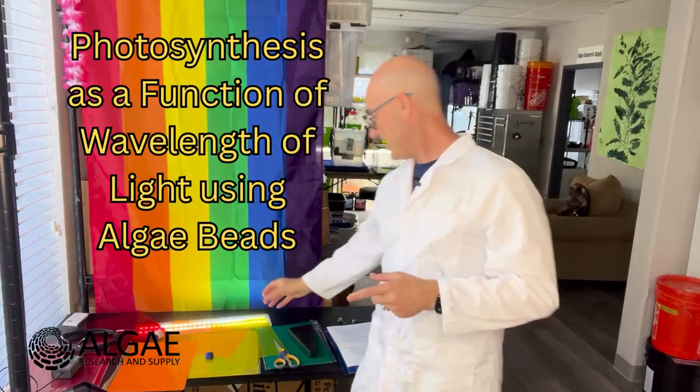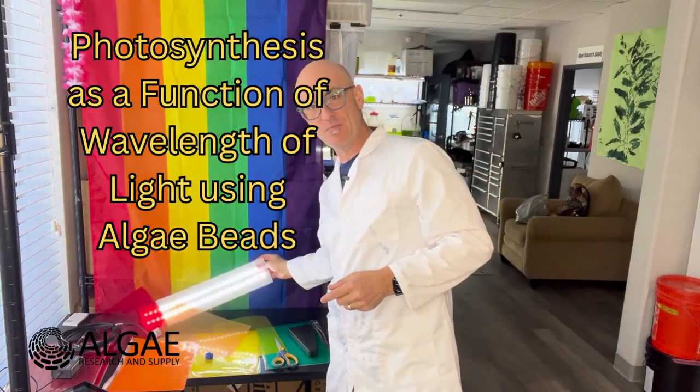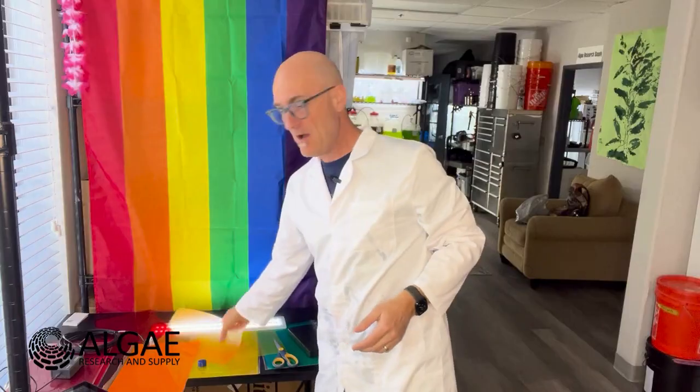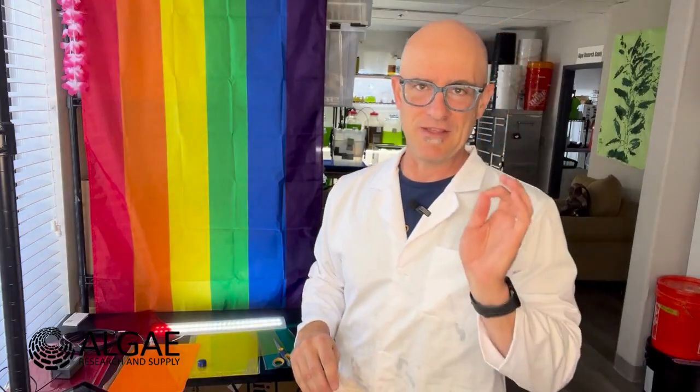Today we're going to try to do something a little bit different here. We have gotten a lot of requests from people to use the different colors of the rainbow, different wavelengths of light, to try to affect the rates at which photosynthesis takes place by giving the wavelengths of light that either will be more or less able to be grabbed onto by the photosynthetic pigments.